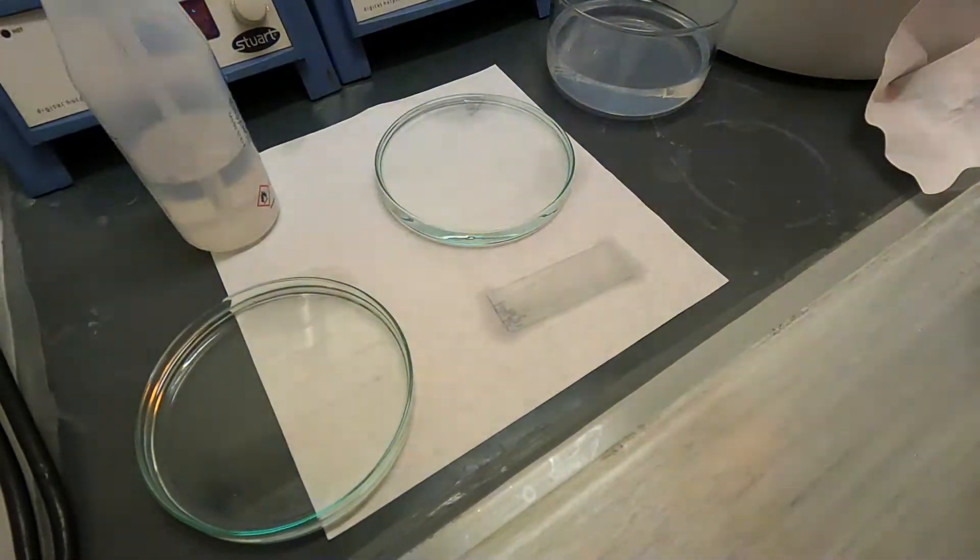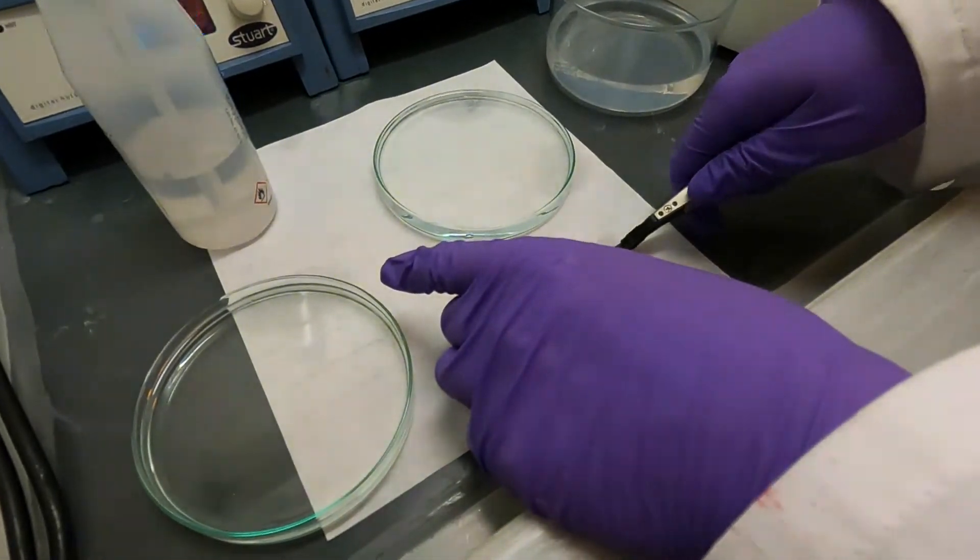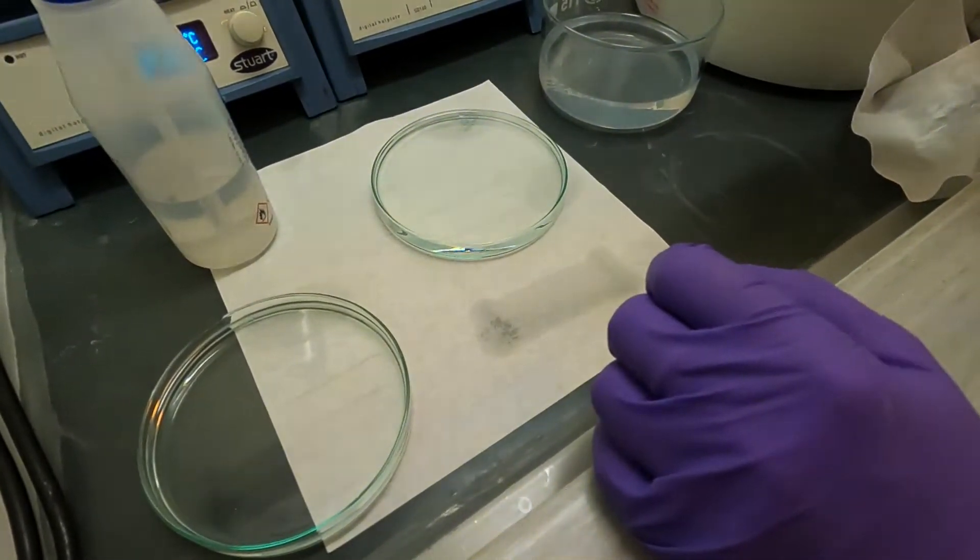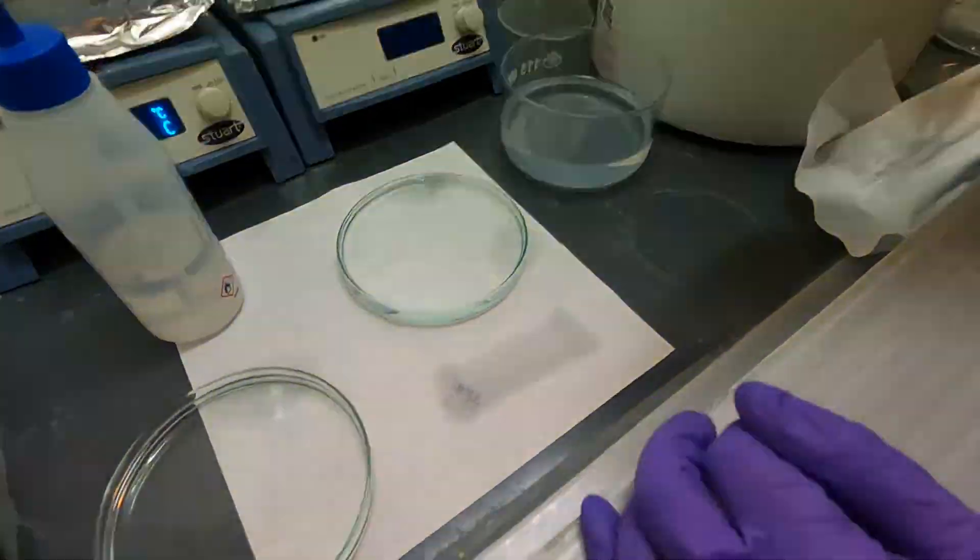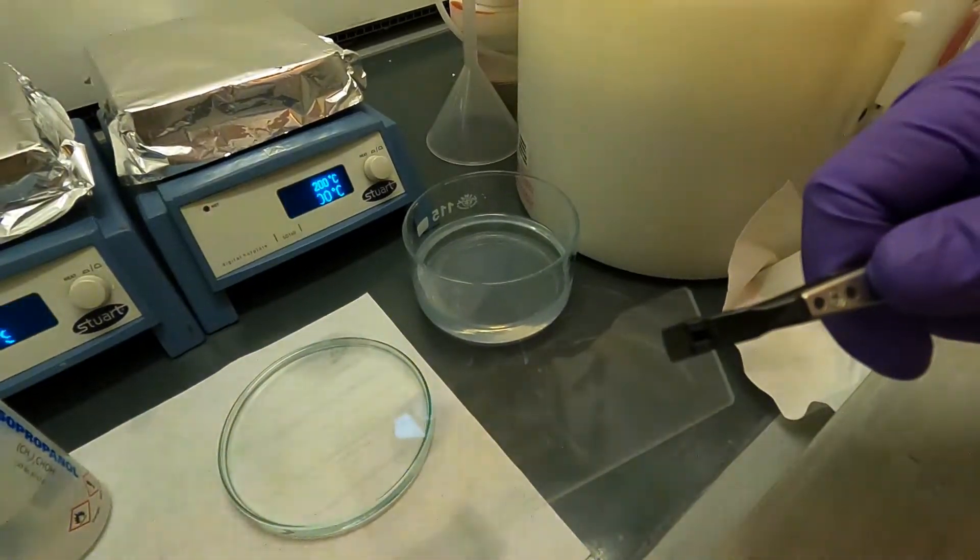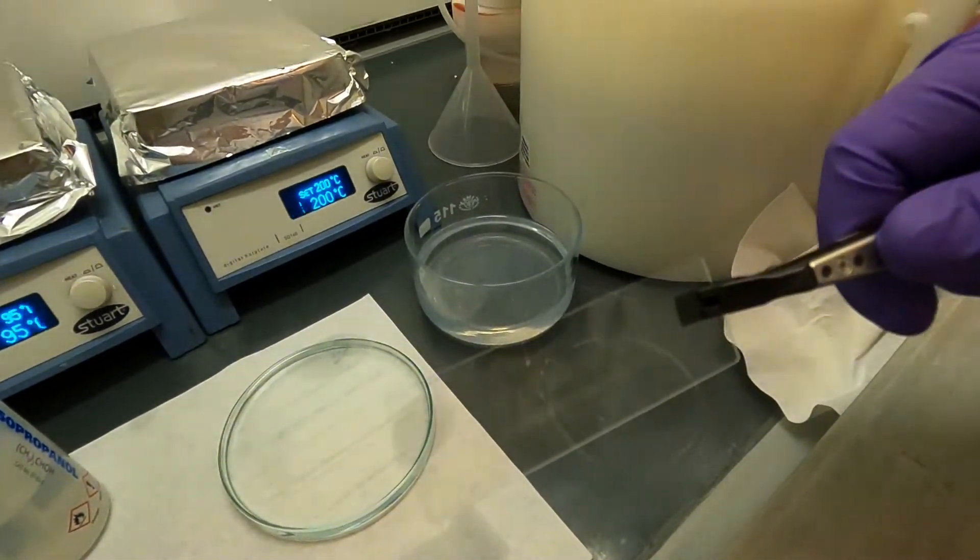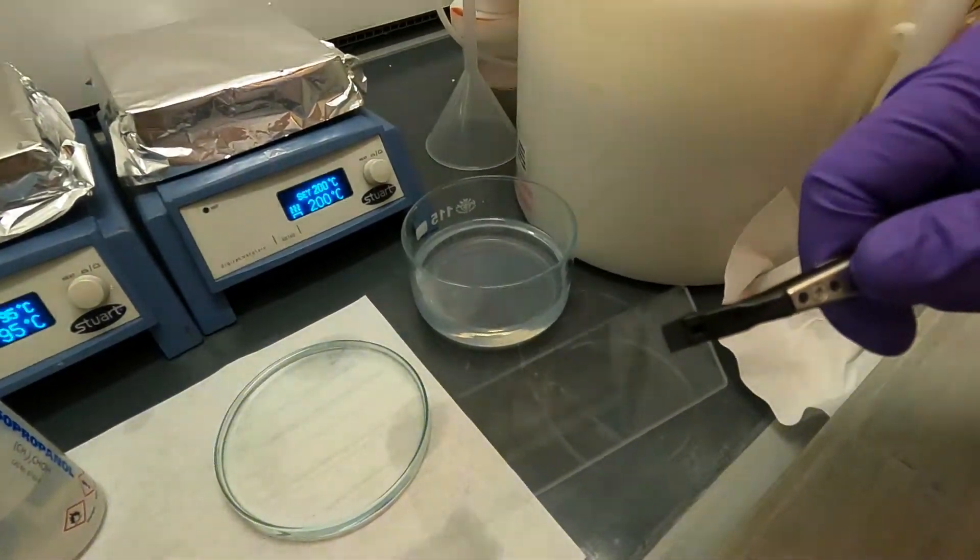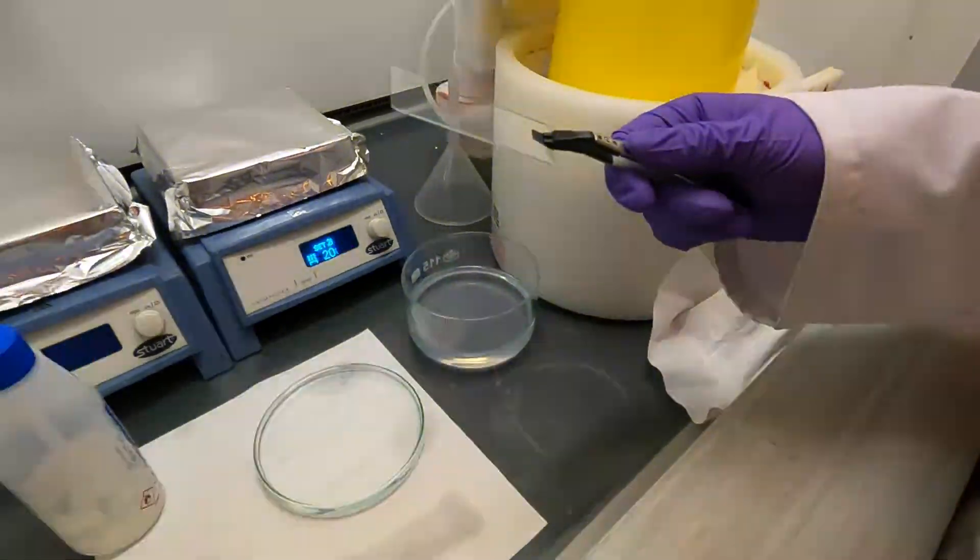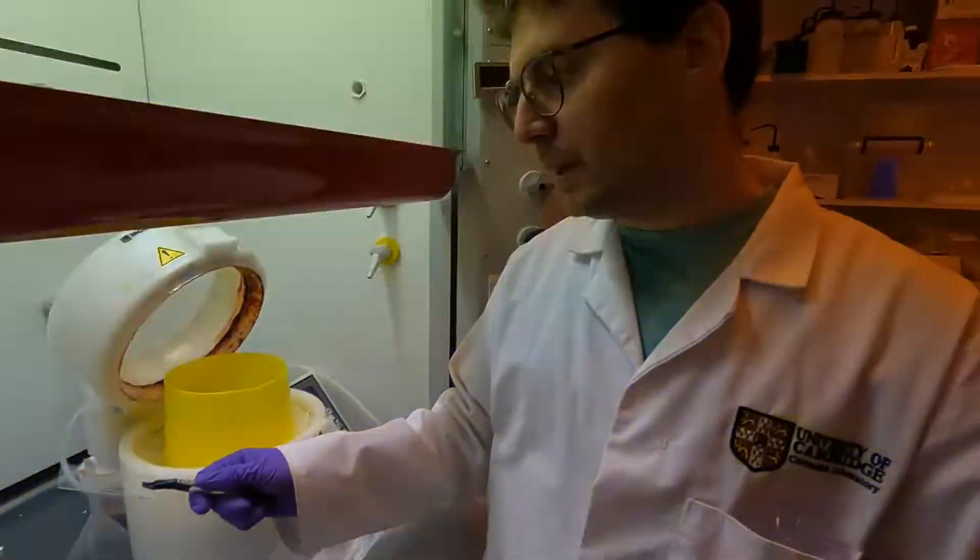This is the development done. I can now lift it up, let the IPA on the back evaporate, and check if the structures are here. I'm not sure you'll be able to see with the contrast of the camera, but you can see there are some structures definitely just over there.